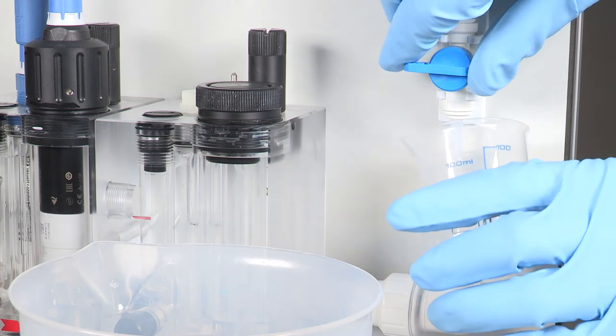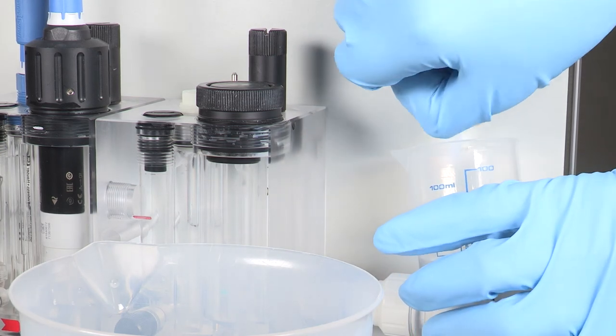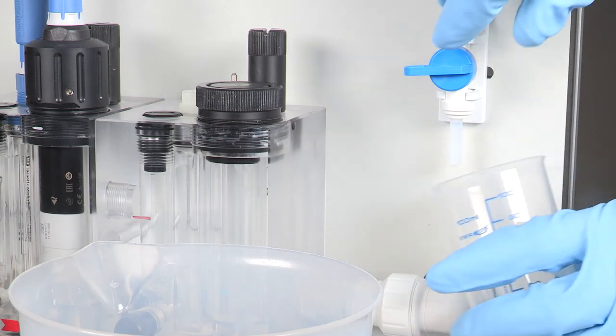Right after that we take a sample out of the sampling line close to the CCA250 assembly.